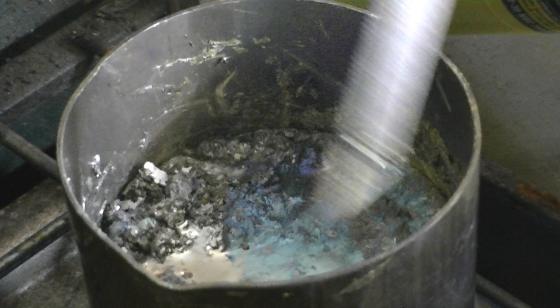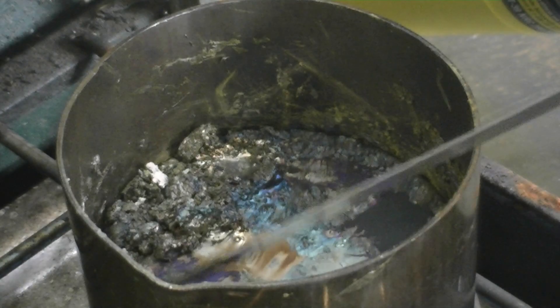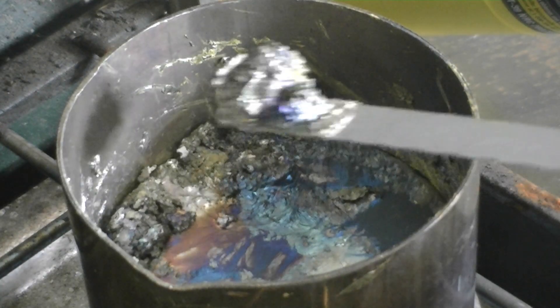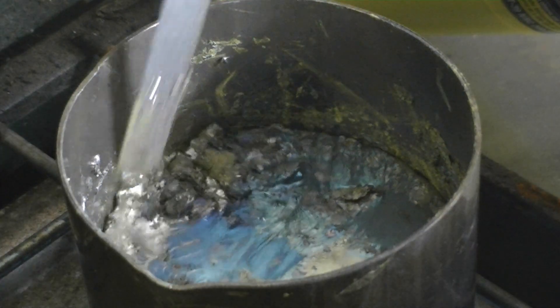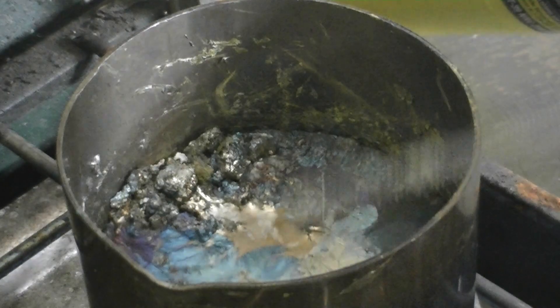I'm going to keep this slag or dross and at some point in the future, I'm going to try that chemical purification process again with the hydrochloric acid and see if I'm going to be more successful at creating nuggets of bismuth metal.